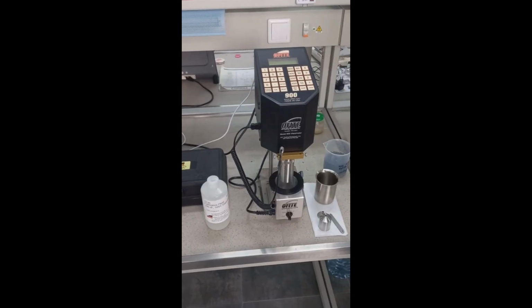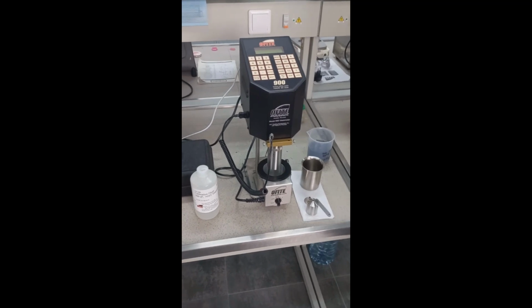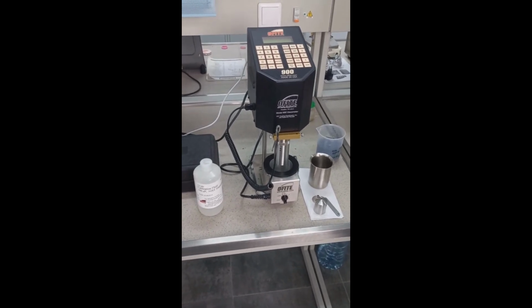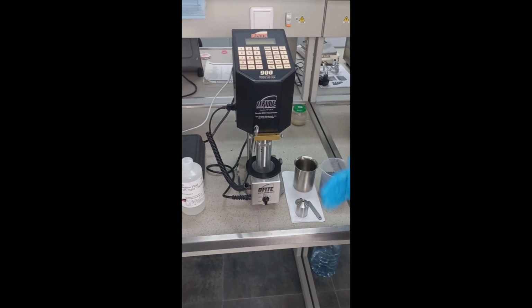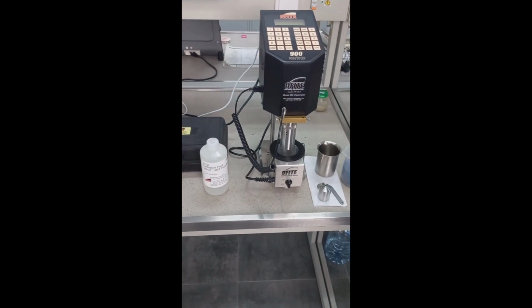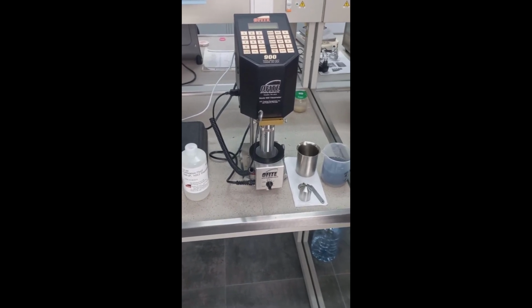The drilling fluid laboratory has a rotational viscometer. The rotational viscometer can be used to measure dynamic viscosity of a drilling mud or a cement slurry. Also, we work with such polymer gel formulations. The accuracy of this device is ensured by using the calibration fluid. This device can measure viscosities over a wide range of temperatures.